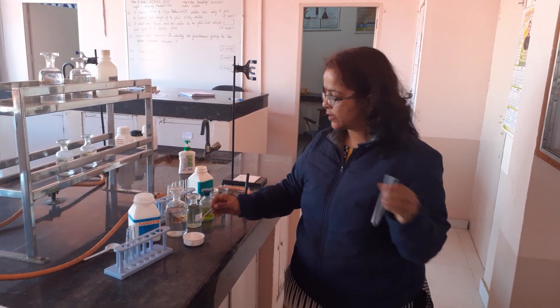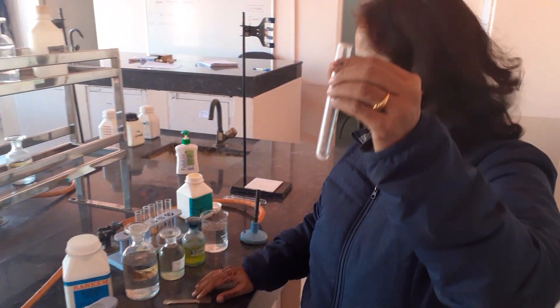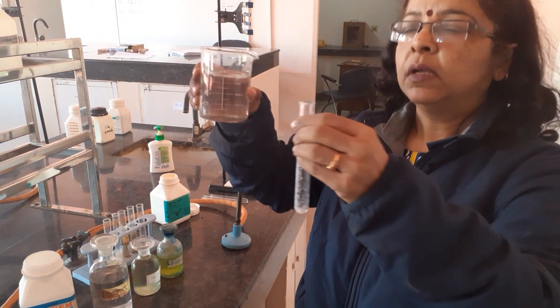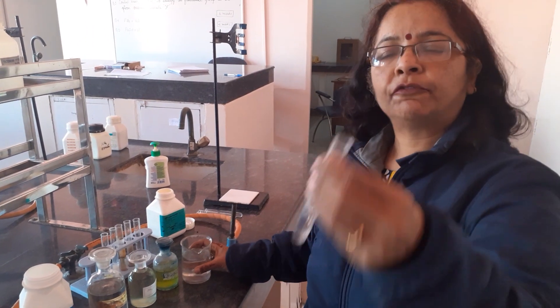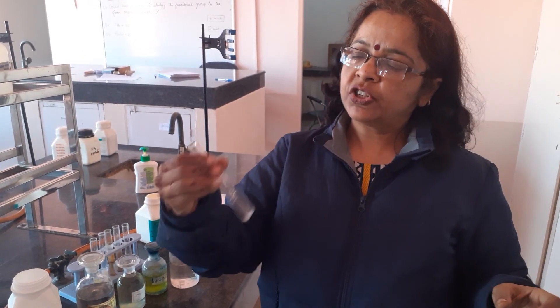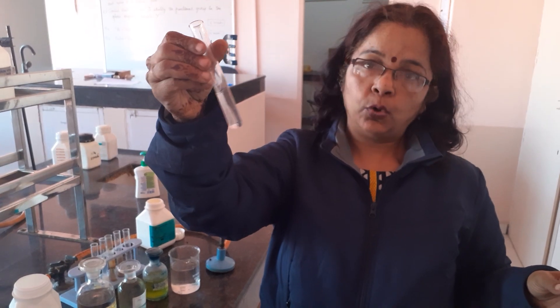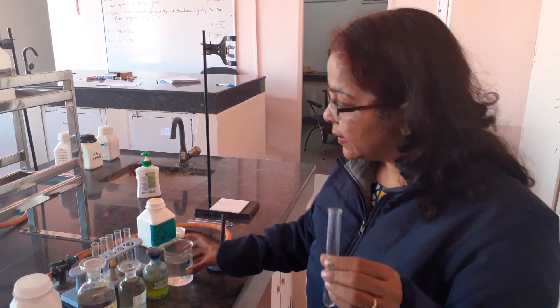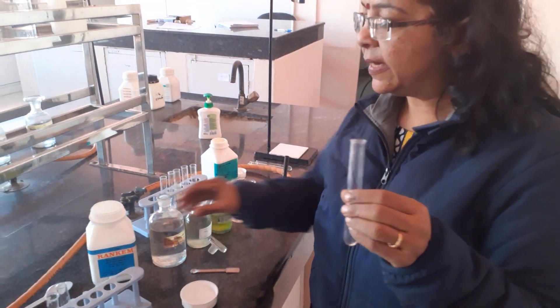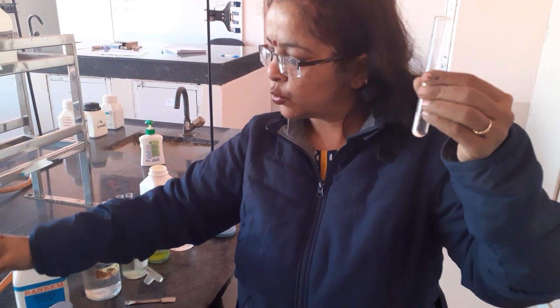Now step 1. Take a pinch of salt in a test tube and add water to it, then shake the contents. Please always proceed after shaking the contents. On shaking, the solution should be clear — this is your OS, or original solution, also called the water extract in schools. I am keeping a stock solution separately as I may require the OS again, so I have just divided it into two.